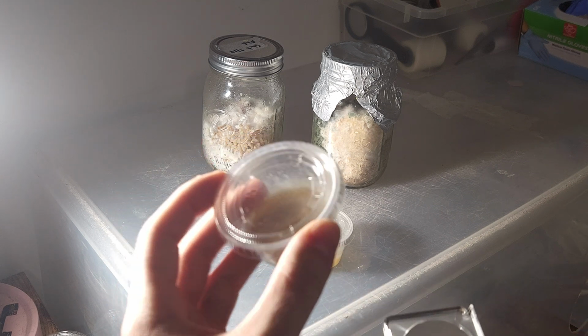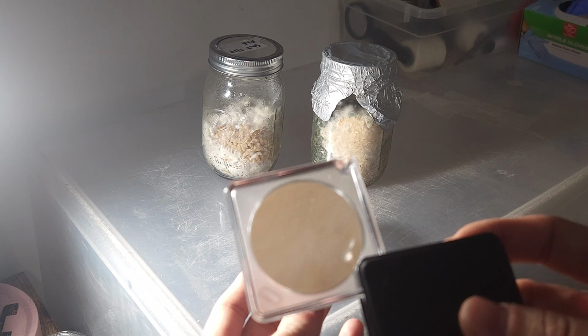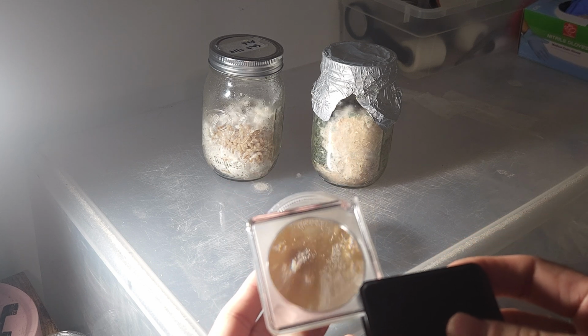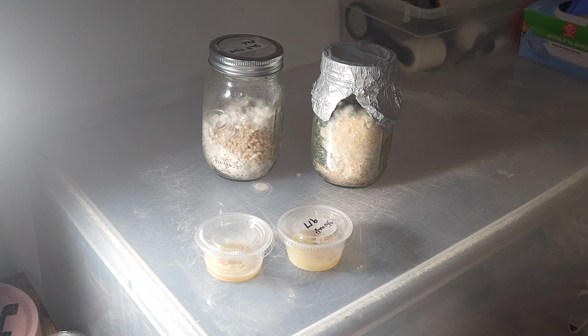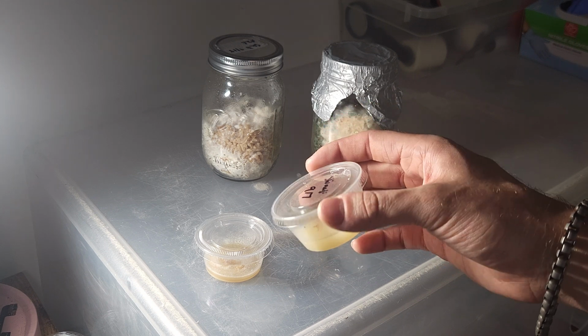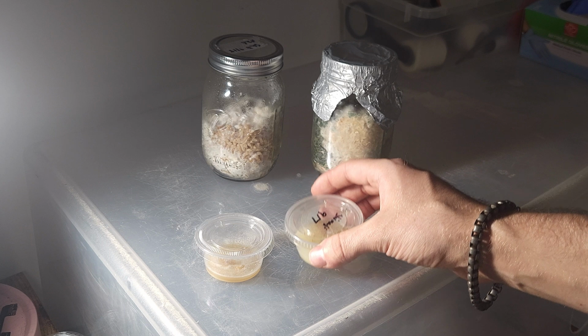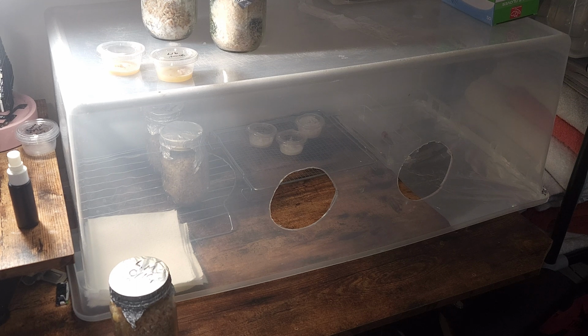Now with these, this likely happened due to improper sterilization, spores falling down onto the surface during the transfer, or dirty tools used during that transfer. All of these samples were when I was using an open-face still air box. To avoid this, you'll always want to use 70% isopropyl alcohol to sterilize your tools and your workspaces, along with flame sterilizing your scalpels before use, and most importantly, a clean environment.